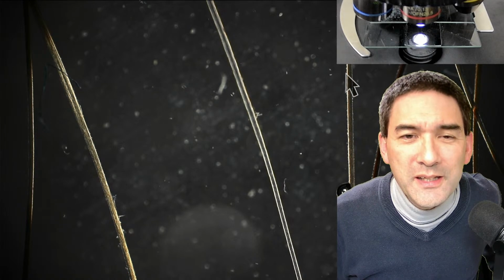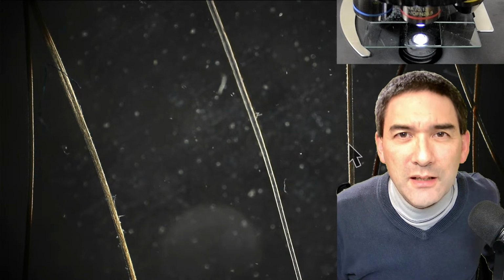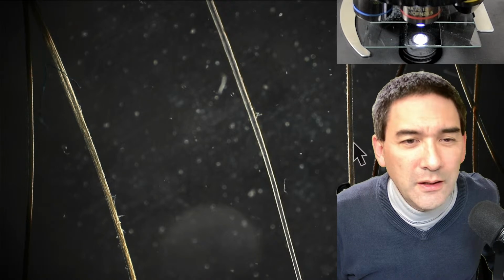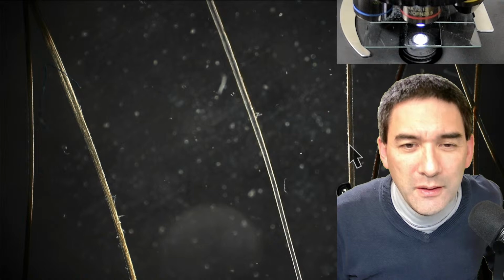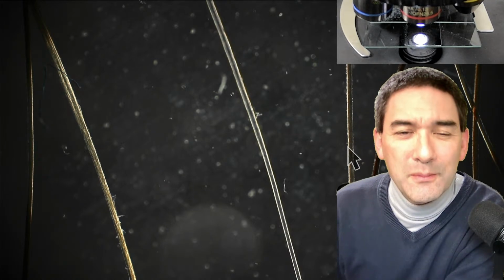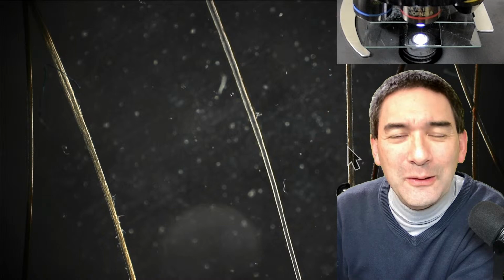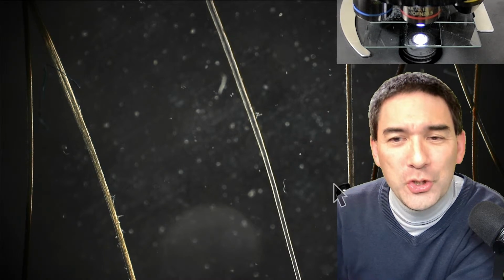Now the hair is brighter on the left side compared to the right side. So you can actually see that if you use a dark field, and you're moving the specimen left and right, the light either strikes it a little bit more from the left or more from the right. This might remind some of you of so-called oblique illumination, where this is actually done over a much larger area as well.